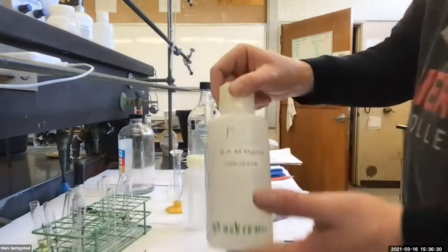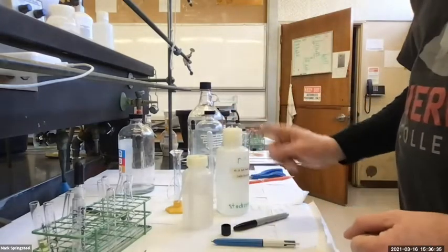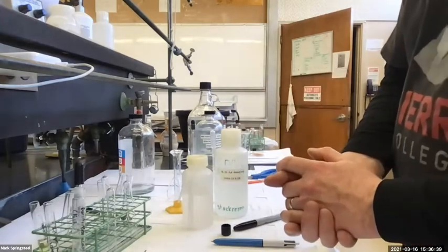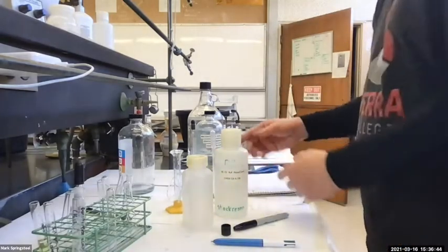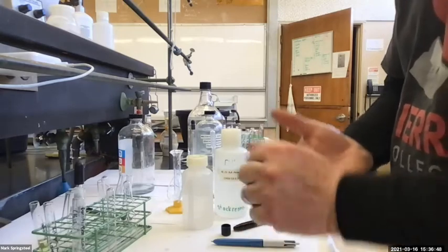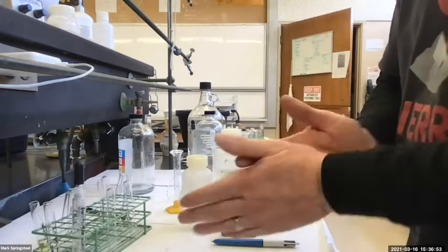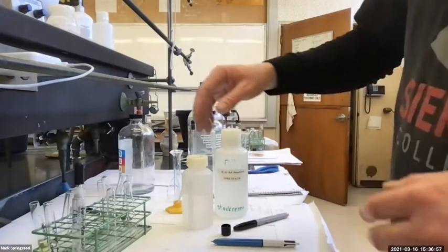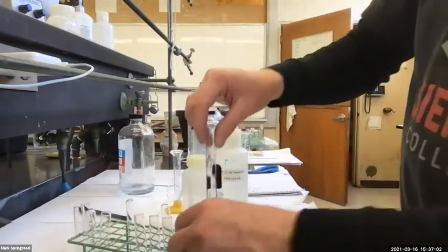I've got it here. And with the 6 molar, that's getting a little bit concentrated. It's not too bad. You could put on gloves at this point, but I think I feel safe and calm with it. If I do get some on my hands, I just wash my hands right away. And as I'm washing my hands, they feel slippery because it turns the oils in your hands to soap. So it feels like you have to keep rinsing your hands because the oils are turning into soap, turning yourself into soap.